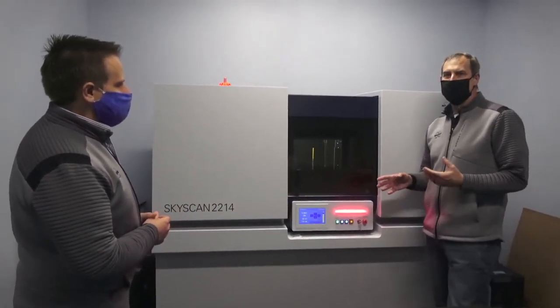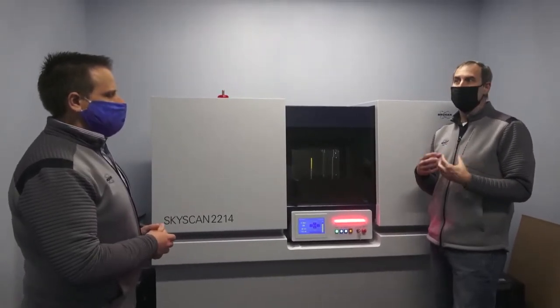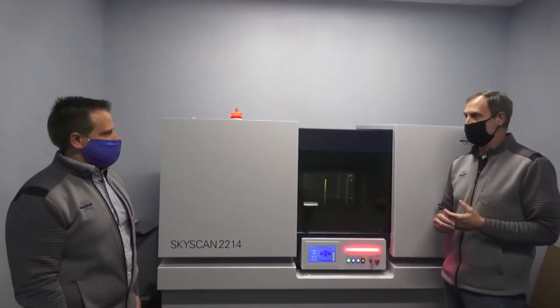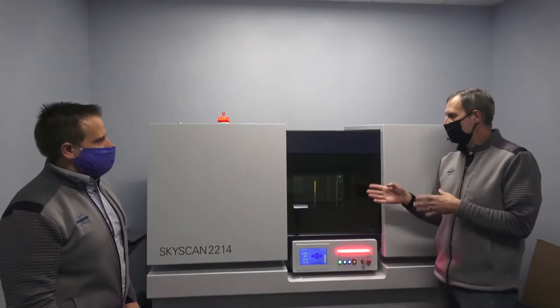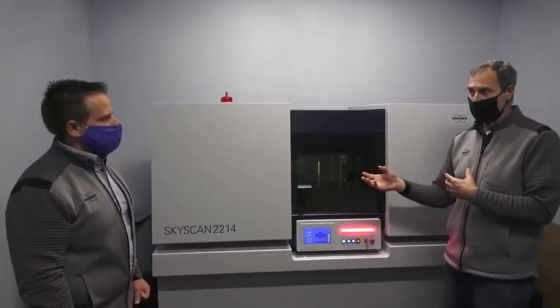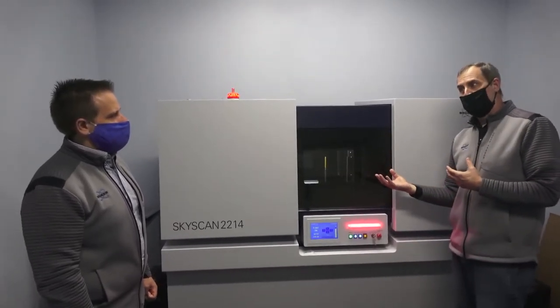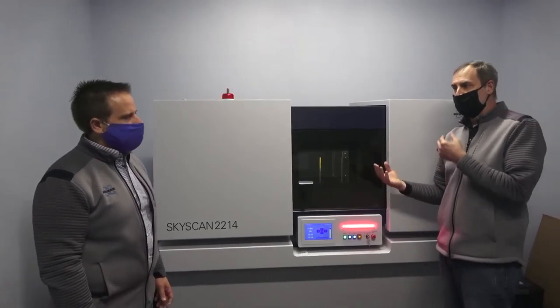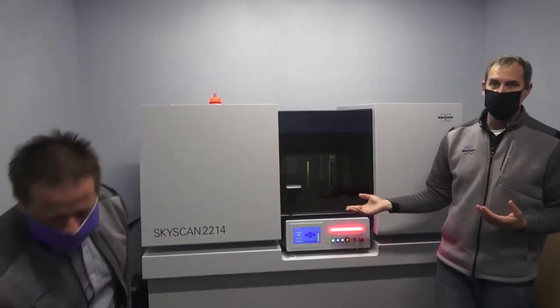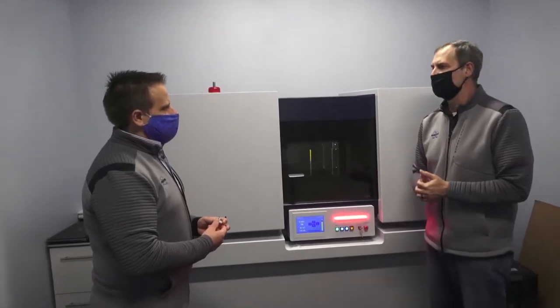There are a couple of key fundamental differences. One of them is the X-ray source. On most desktops, you have a closed X-ray source — easy and simple to use, very low maintenance. This one has an open source, so you actually have a filament that you can change in and out. It's much bigger and generates a lot more power. We can get a higher, brighter source with a smaller beam. This one will go down to less than 500 nanometer spot size, whereas three to five microns is typical for a benchtop.